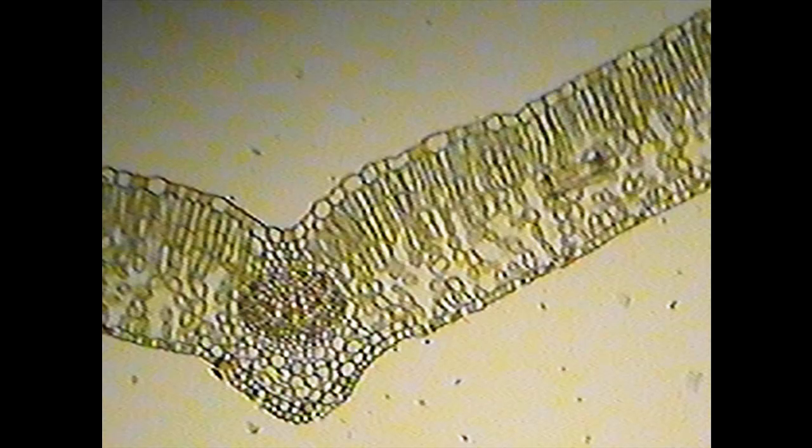So here we go. This is a real image of an actual leaf. Let's try and identify some of the tissues here. At the top we've got the epidermis. I can't make out a cuticle, probably just too thin to see, or maybe it has barely any cuticle. On the lower surface we've got an epidermis there too. Out here on the sides we can see the palisade mesophyll, nice and rod shaped, spongy mesophyll with lots of gaps, and then in the middle it gets a little bit more complicated.